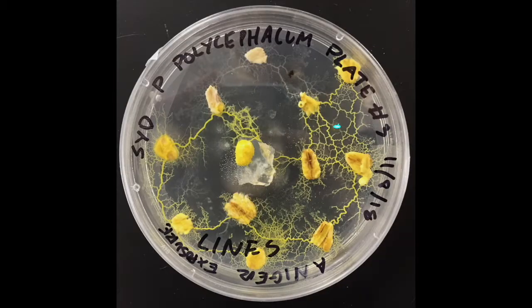Looking at the rightmost one, the same thing is starting to happen. You can see the ends of the slime mold beginning to trail away pretty much — they've sort of packed up their things and are moving quickly away from the Aniger. Not fully evacuated yet, but you can see them starting the process in action.